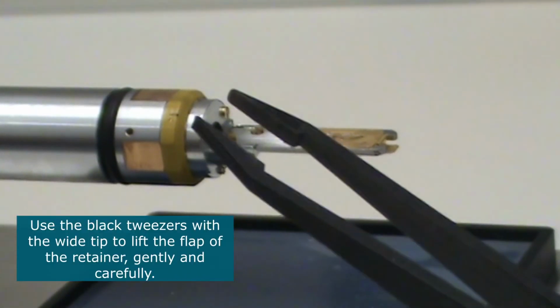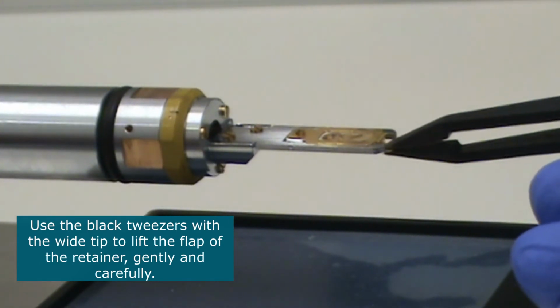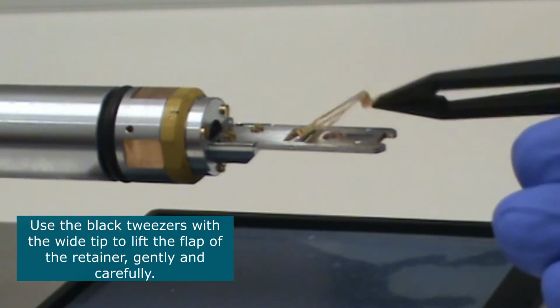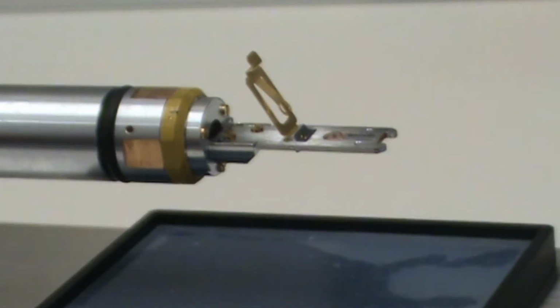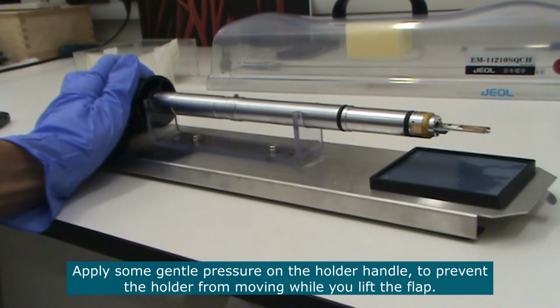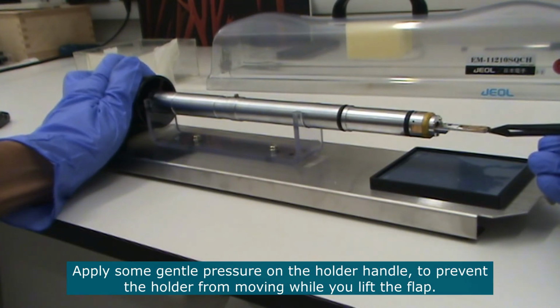Use the black tweezers with the wide tip to lift the flap of the retainer gently and carefully. Apply some gentle pressure to the holder handle while you're doing this to prevent the holder from moving.